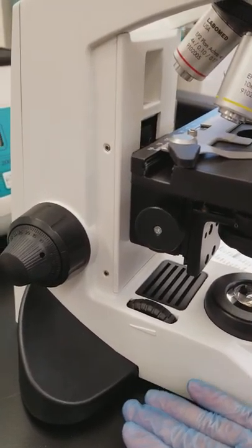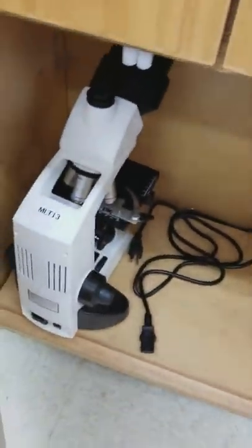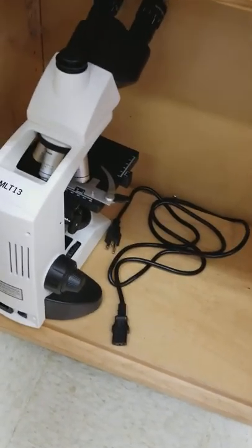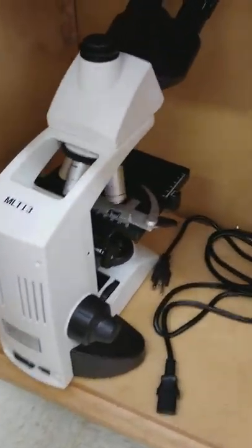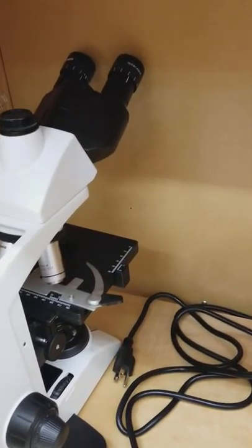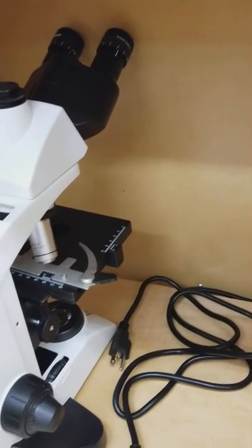So that we can then put it into the lower cabinets here. Notice there's already one in there right now. Make sure that you are careful not to hit the back wall of the cabinet.